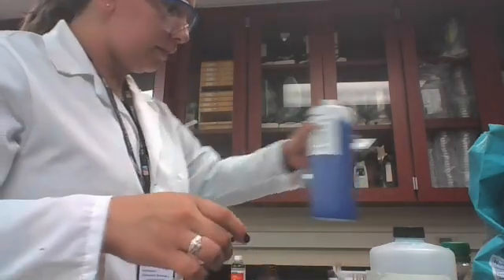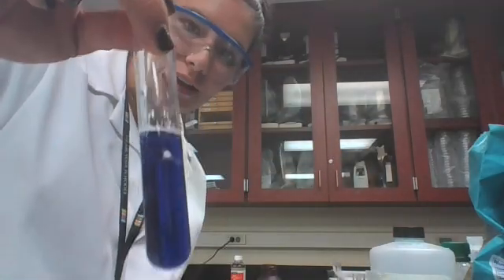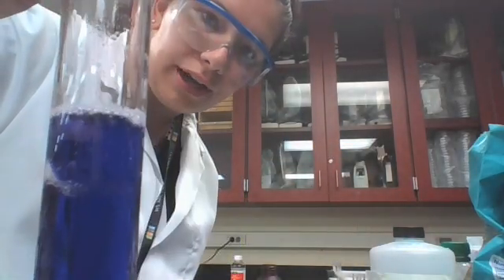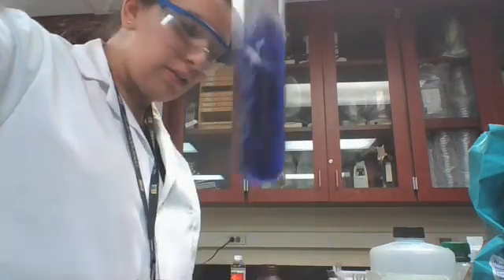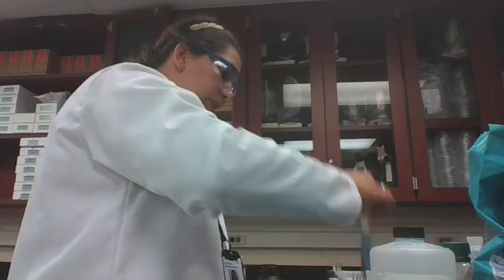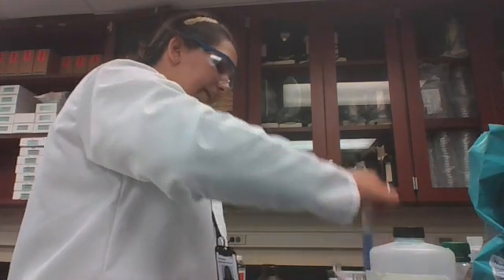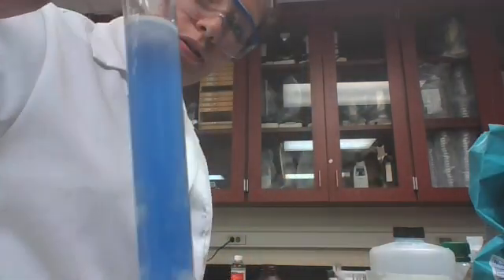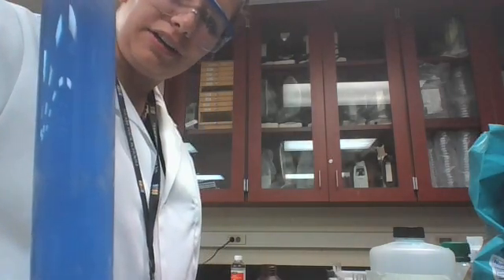Alrighty. So Biuret's reagent. This is the egg protein, turns a nice dark purple. And that is egg protein. So you can see how awesome that is. In our water sample, to compare it, it's a light blue. It's a pretty big difference. And in our sample, you kind of see a light blue. You can see all the nice stomach acid in there. So we're going to call that a negative.